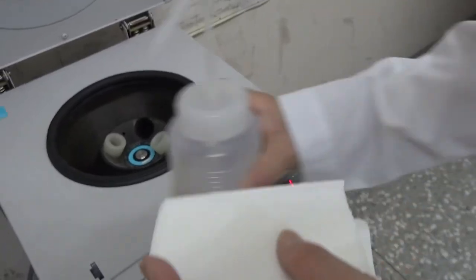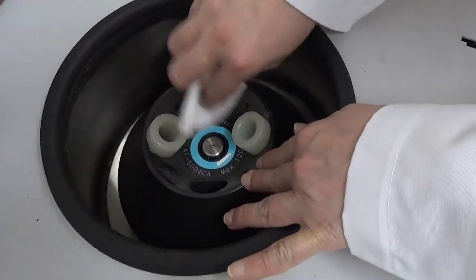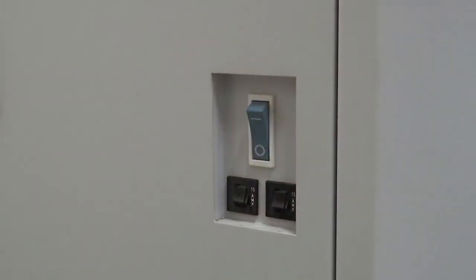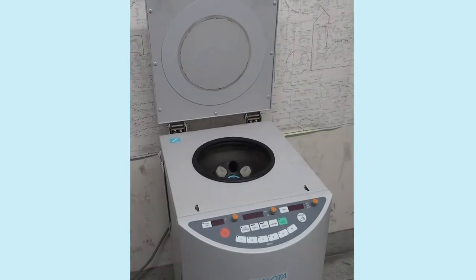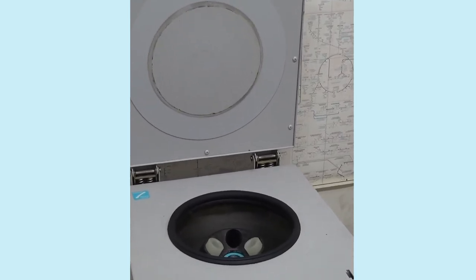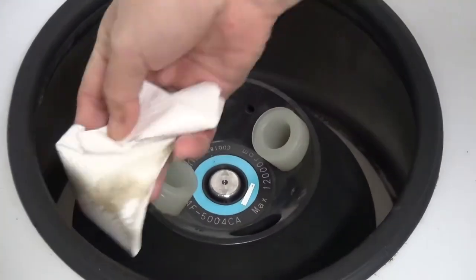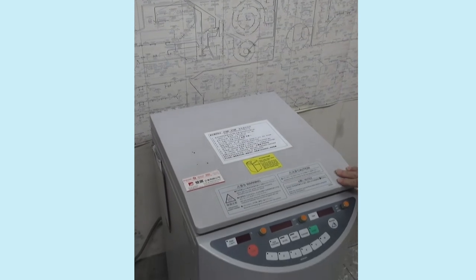When operation of the centrifuge is finished, please wipe it clean and keep it dry to avoid rusting. Finally, turn off the power and unplug the plug. If it was used in low temperature, please open the lid to allow for return to room temperature and wipe the water drops inside the centrifugal tank. When it is not in use, please close the lid to avoid dust settlement.